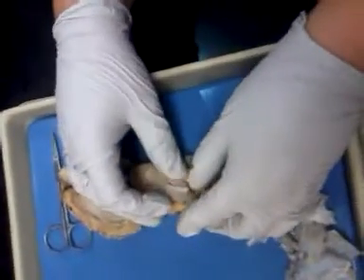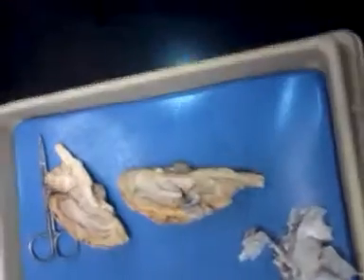You to send me that video. Okay. Send you that video. Okay, I need your little probe here. Please probe it.